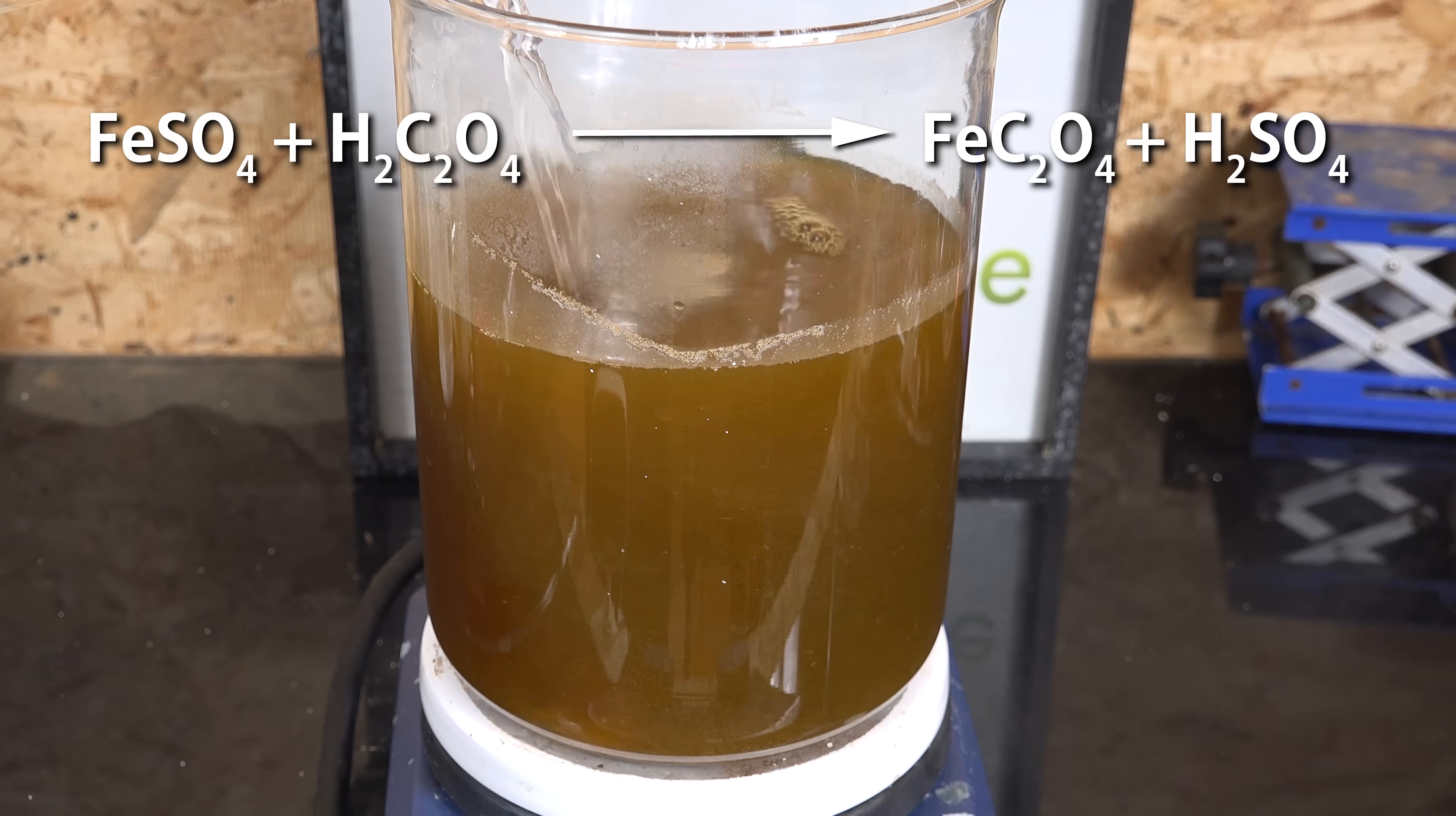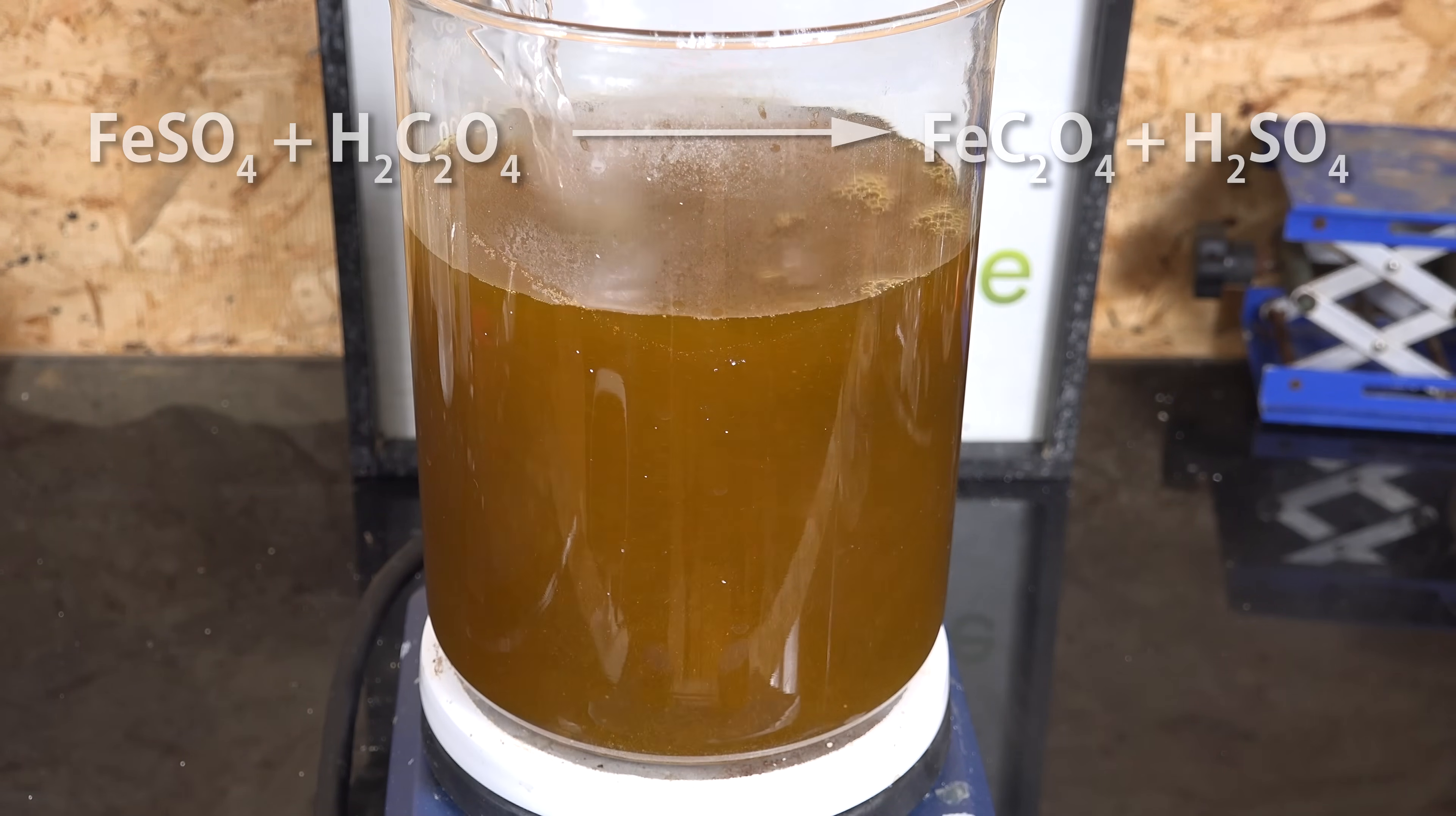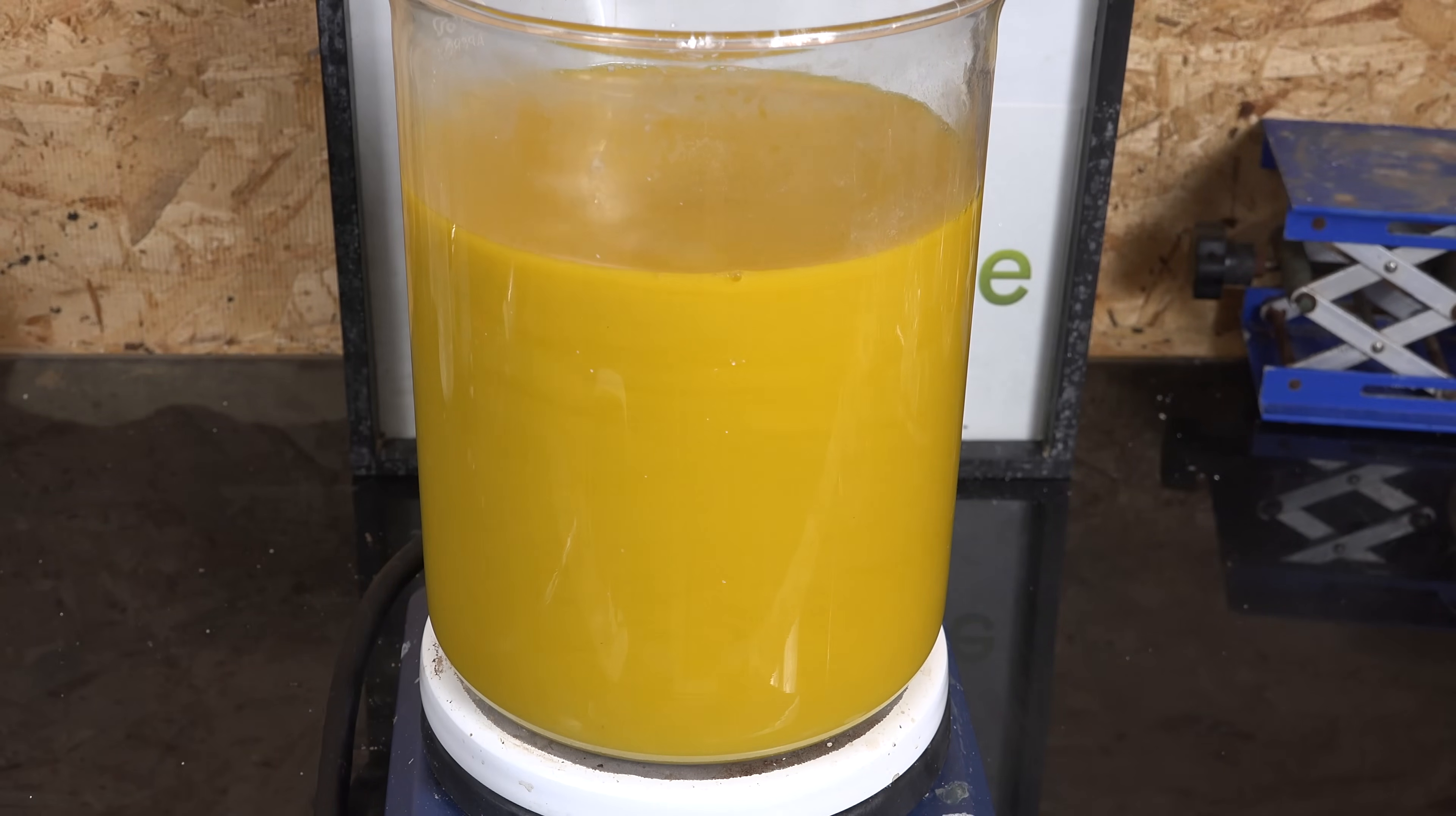You can push the reaction forward somewhat by diluting the chemicals with even more water to reduce the overall concentration of sulfuric acid. I couldn't do that because I was limited by my glassware.